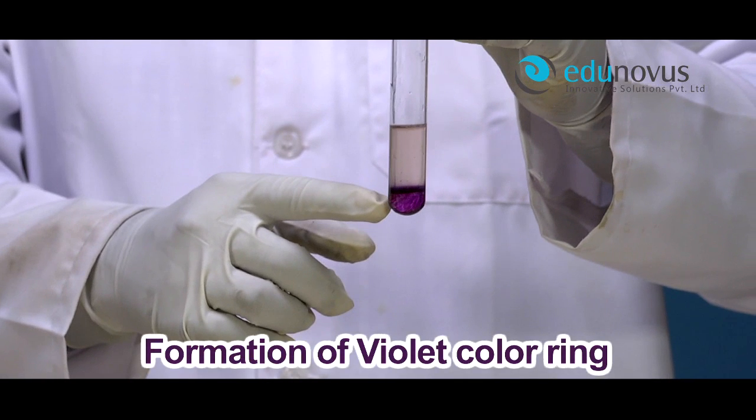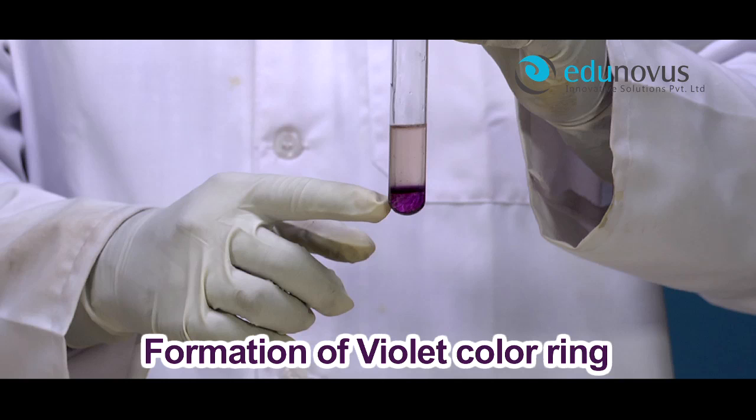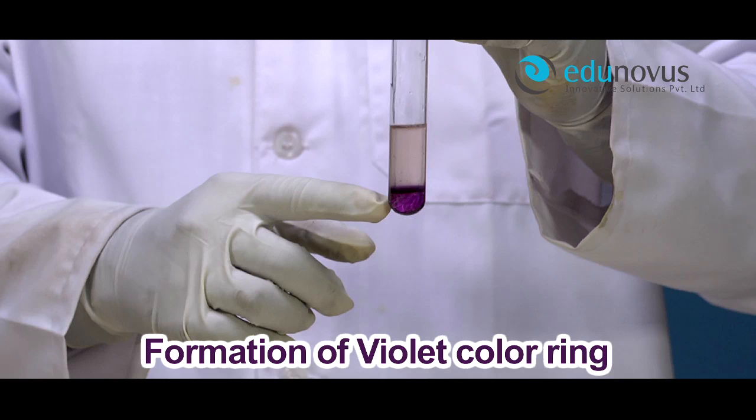Formation of a violet color ring at the junction of two layers indicates the presence of carbohydrates in the given food compound.